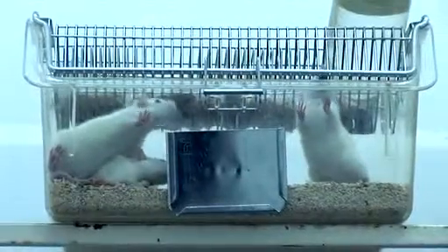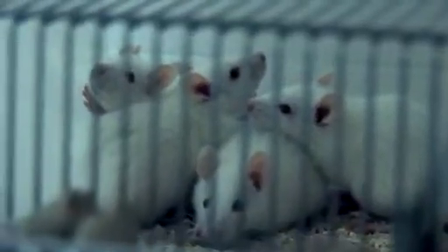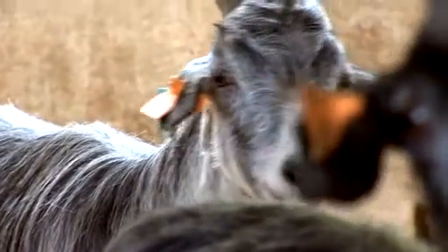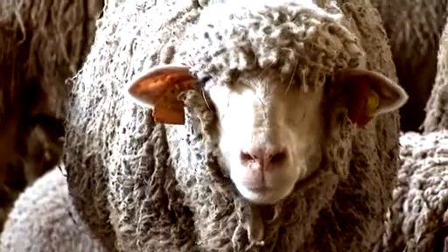The equipment available allows setting up surgical procedures aimed at testing the performance of the assembled constructs for different tissue engineering applications. Through our cooperation with the Veterinary School of Trás-os-Montes e Alto Douro University, we can set up experiments with medium-sized animal models such as goats.